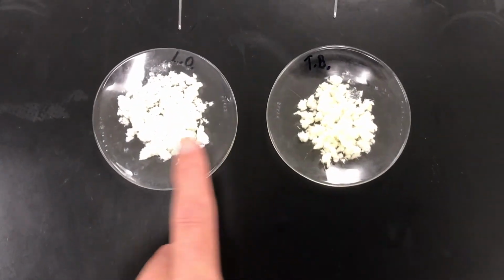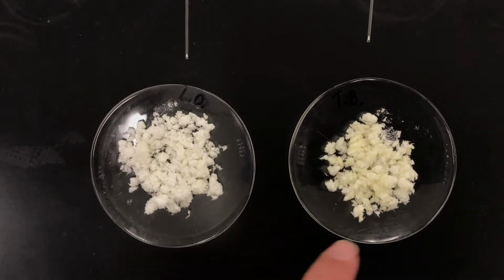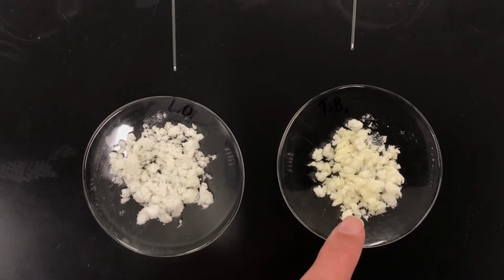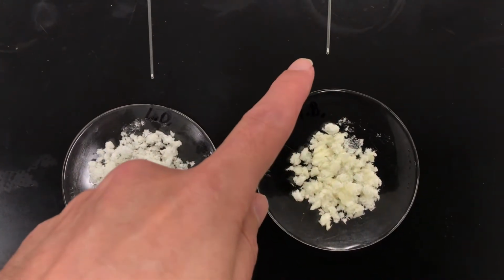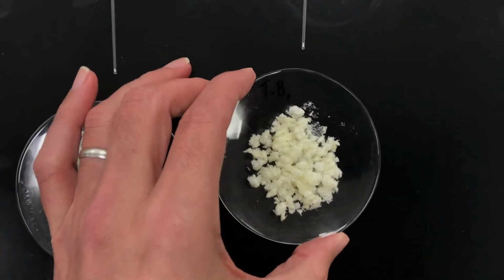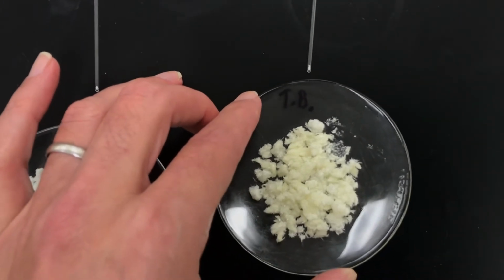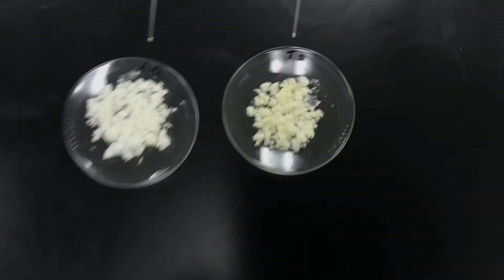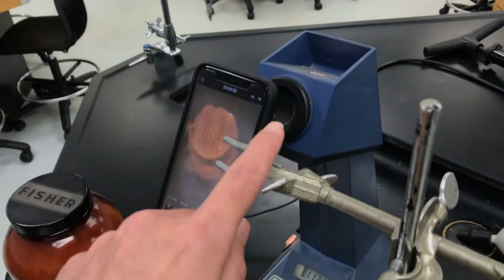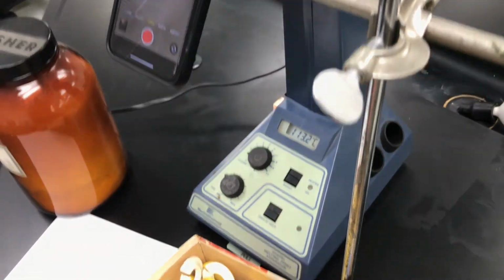Here on the right, you can see the color is significantly more yellow, and it does have an off odor. It's really hard to explain. And I've prepared a melting point capillary tube of this substance as well. So this is the Traverse Bay sample, okay? And so I'm going to go ahead and load the microcapillary tubes into this melting point apparatus, take a picture with my phone at the same time that I'm recording the temperature.